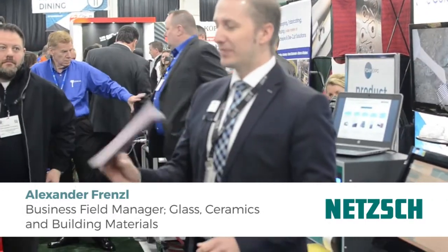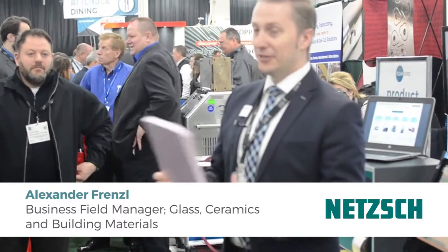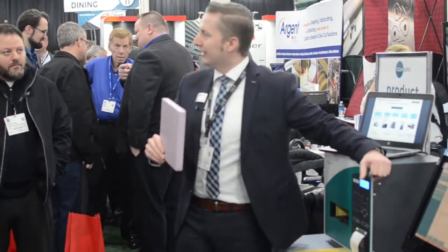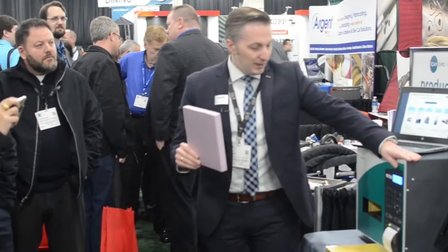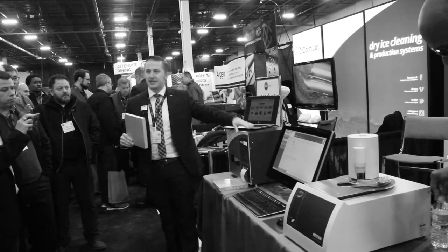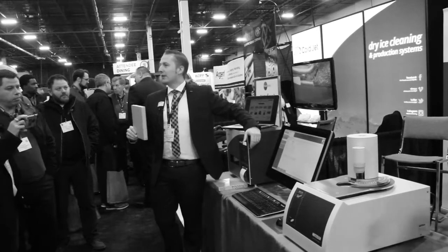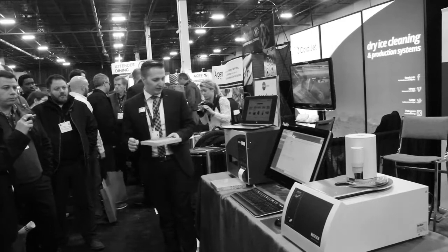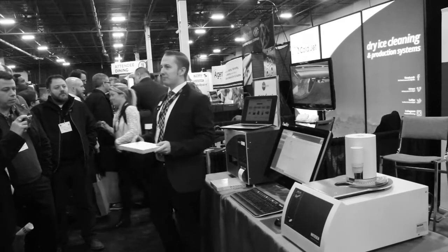What we are talking about today is measuring thermal conductivity on things like that. It is a very basic method, done with an instrument like this — a so-called heat flow meter. There are some standards in the industry. This is the ASTM C518, which tells you how to build an instrument and how to measure thermal conductivity with the so-called steady-state method.